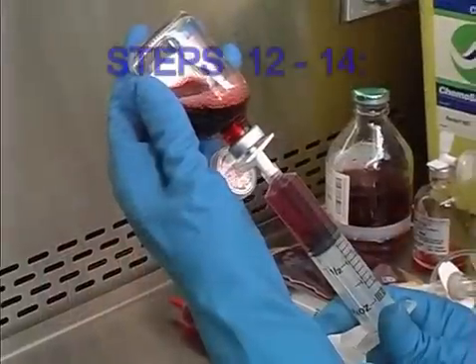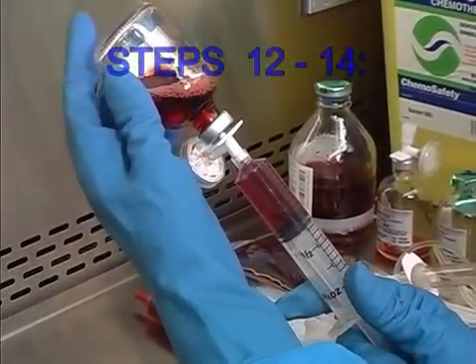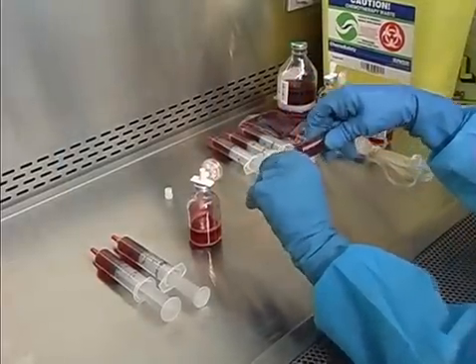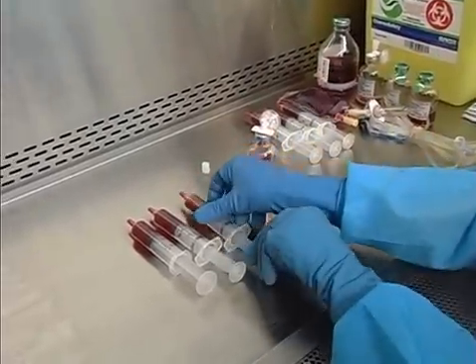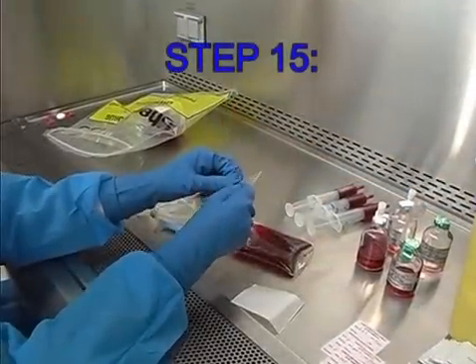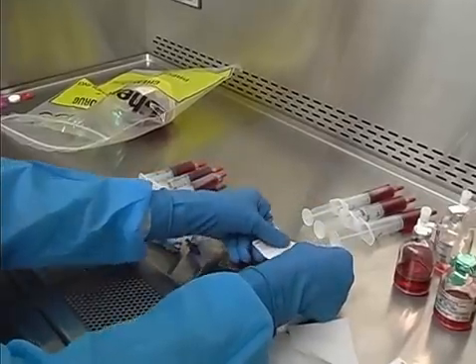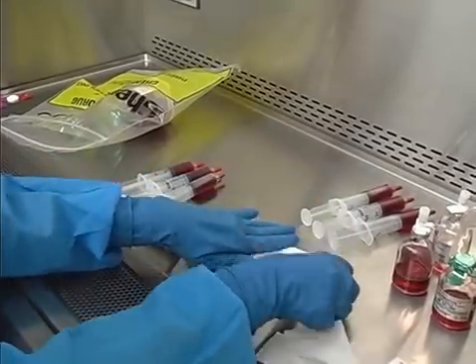Steps 12 through 14: Using a dispensing pin, prepare 3 each 10 ml syringes from the VM 25 vial diluted in step 8. Step 15: Properly prepare and label the vials diluted in steps 7 and 8, as well as all final containers and syringes prepared.